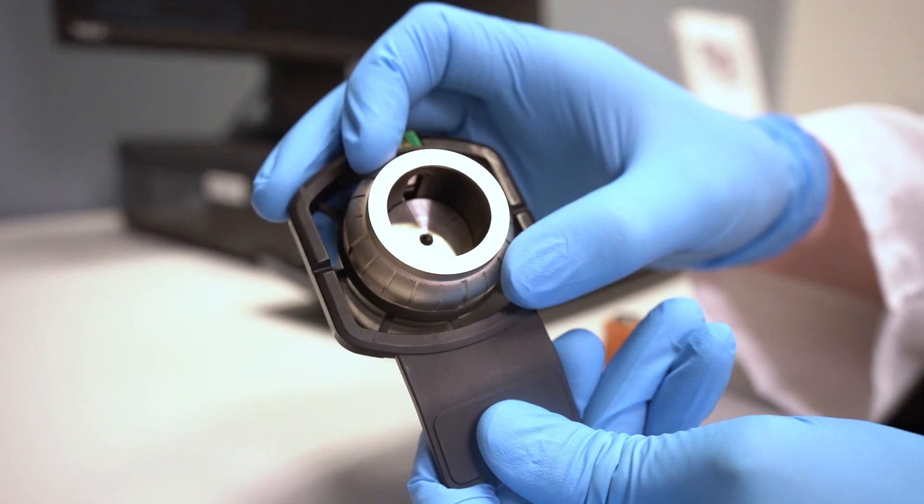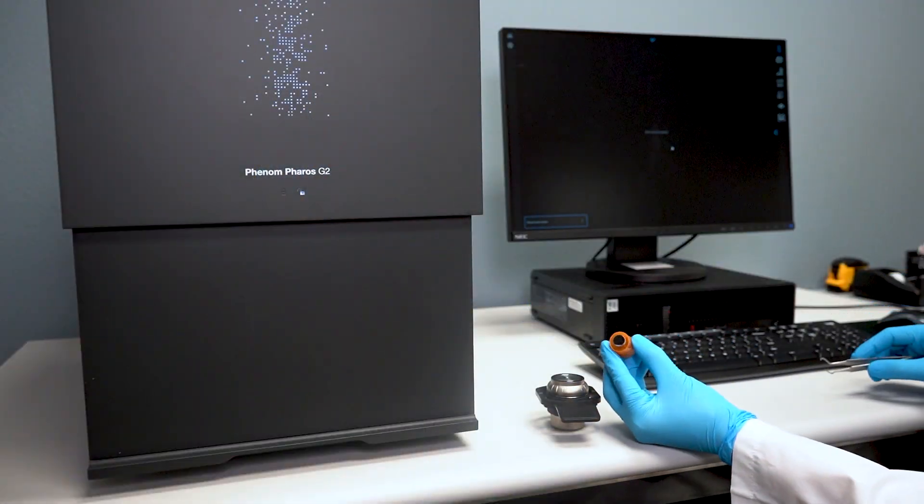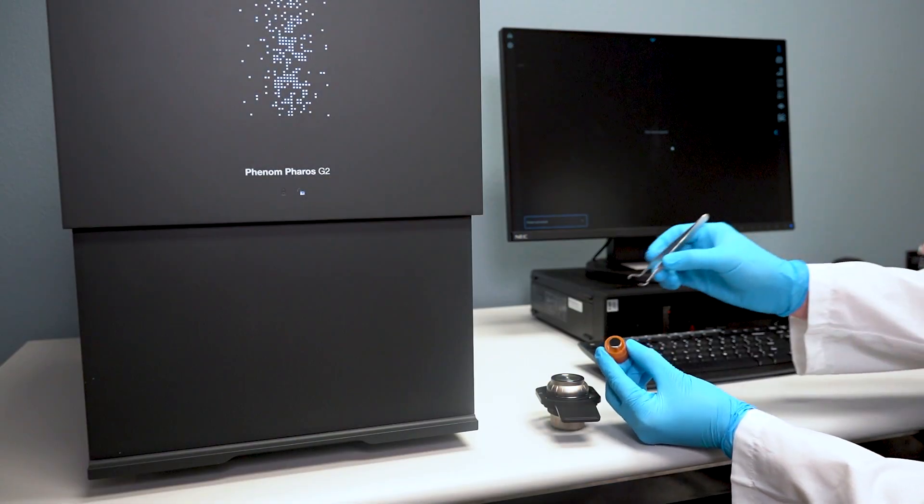I have a sample mounted on a standard aluminum stub which I will pick up with tweezers and place into the sample cup.